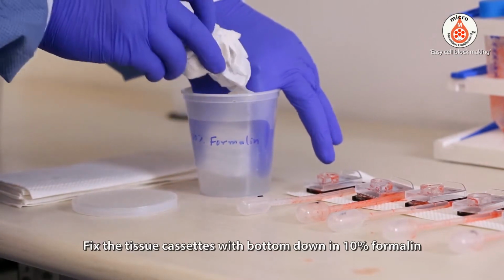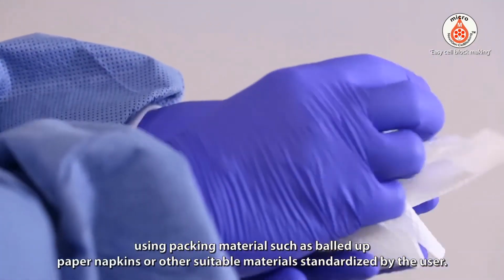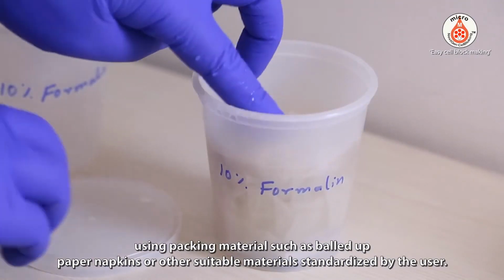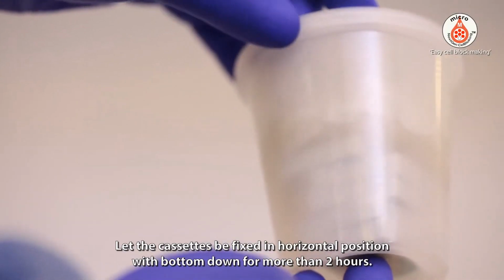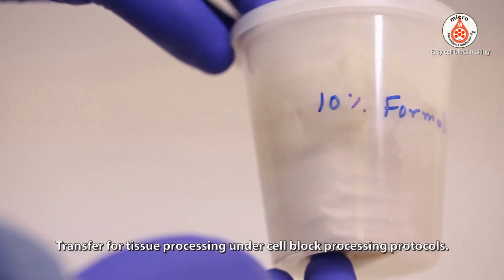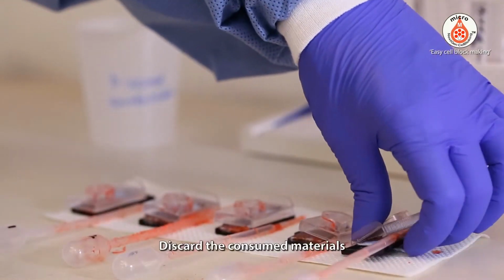Fix the tissue cassettes with bottom down and 10% formalin for at least 2 hours in horizontal position, using packing material such as balled up paper napkins or other suitable materials standardized by the user. Let the cassettes be fixed in horizontal position with bottom down for more than 2 hours. Transfer for tissue processing under cell block processing protocols. Discard the consumed materials.